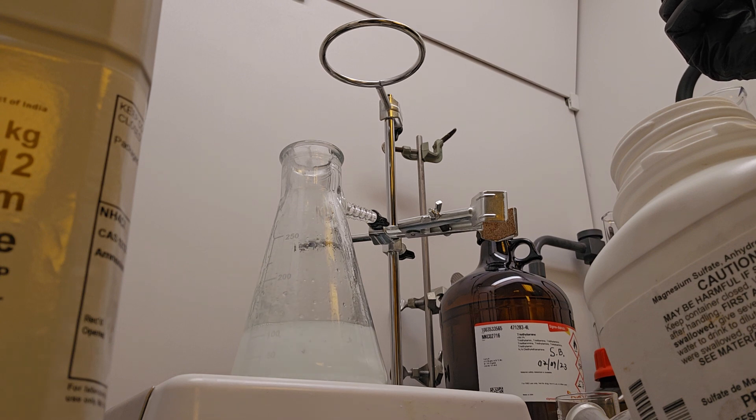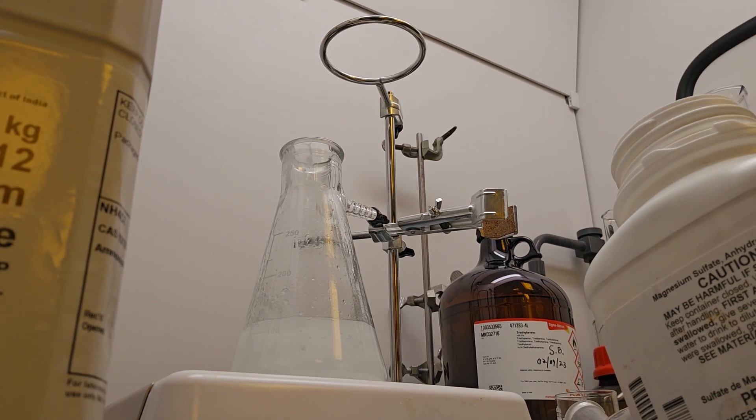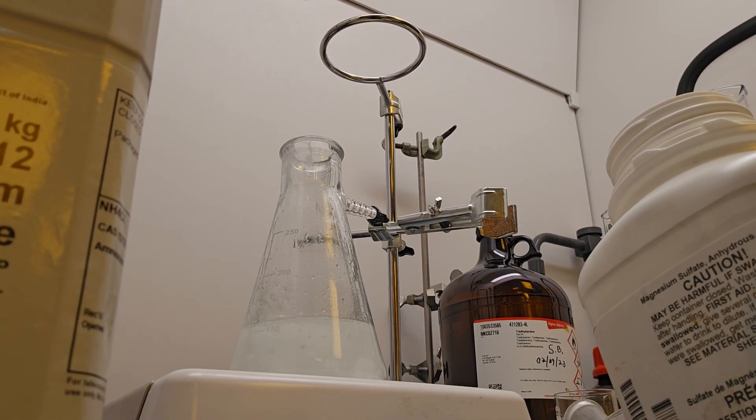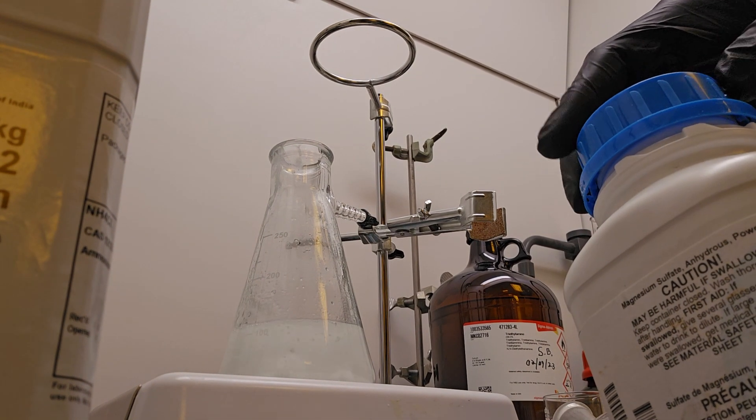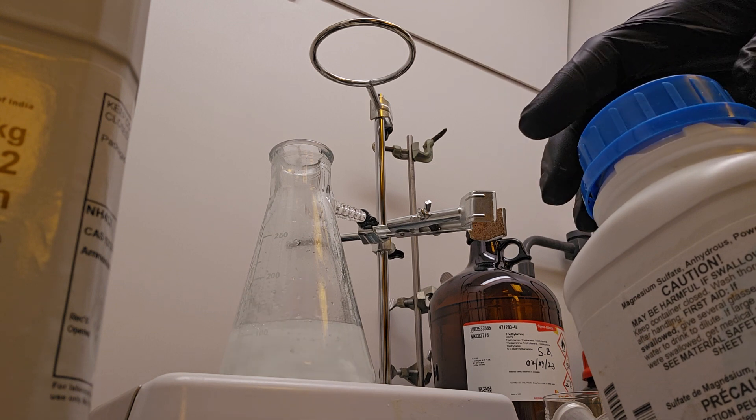Yeah, we really got large clumps now. So what that means is the magnesium sulfate ions, or molecules, are grabbing onto the water that exists.